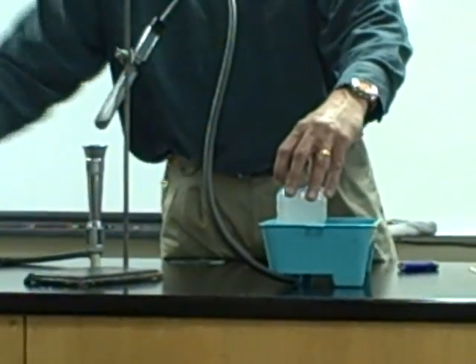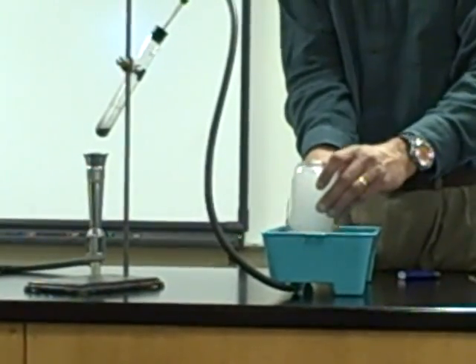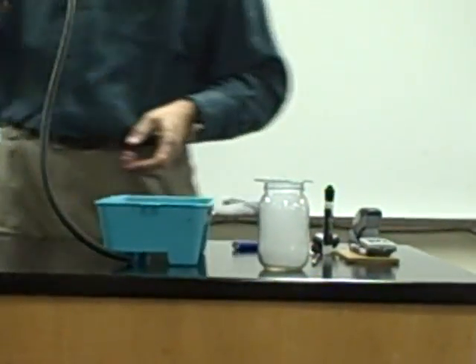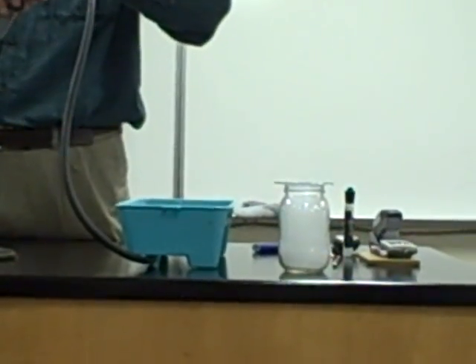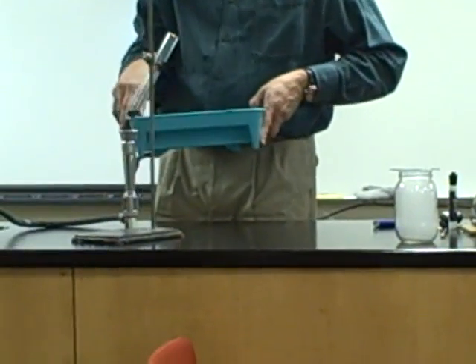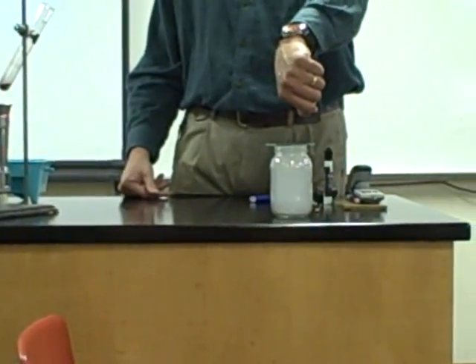I'll let it react until my jar fills, then shut the gas off. I'll take my cover slip and just lift this jar up just a little bit — just enough to get my cover slip underneath it. What's inside that jar now? What type of gas? Oxygen gas. Well, technically it's not pure oxygen gas — in fact, you can see there's something else in there. There's a bit of water vapor in there. That's something we have to contend with. So yeah, in reality it's not pure O2 gas, but it's much more pure than if I were to just have that rubber tubing inside that jar in the room air.